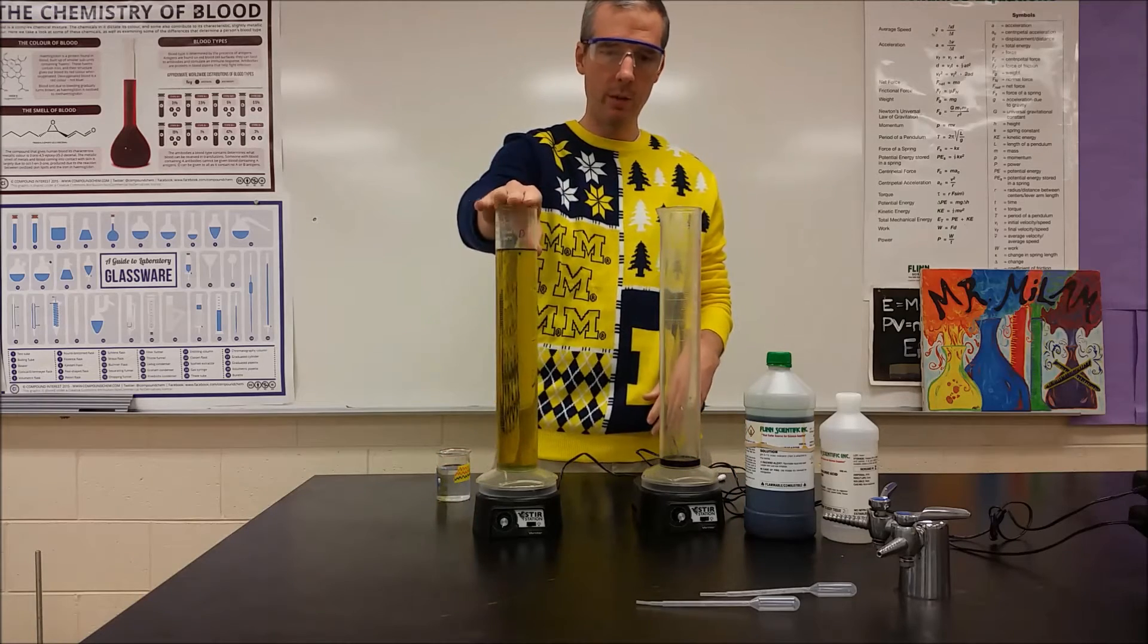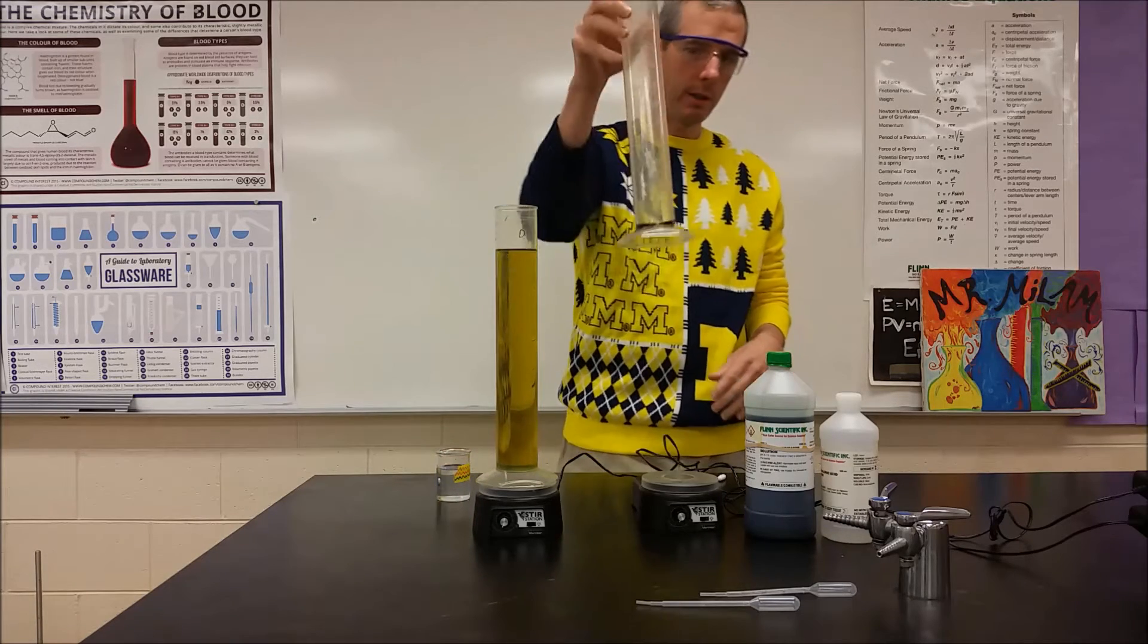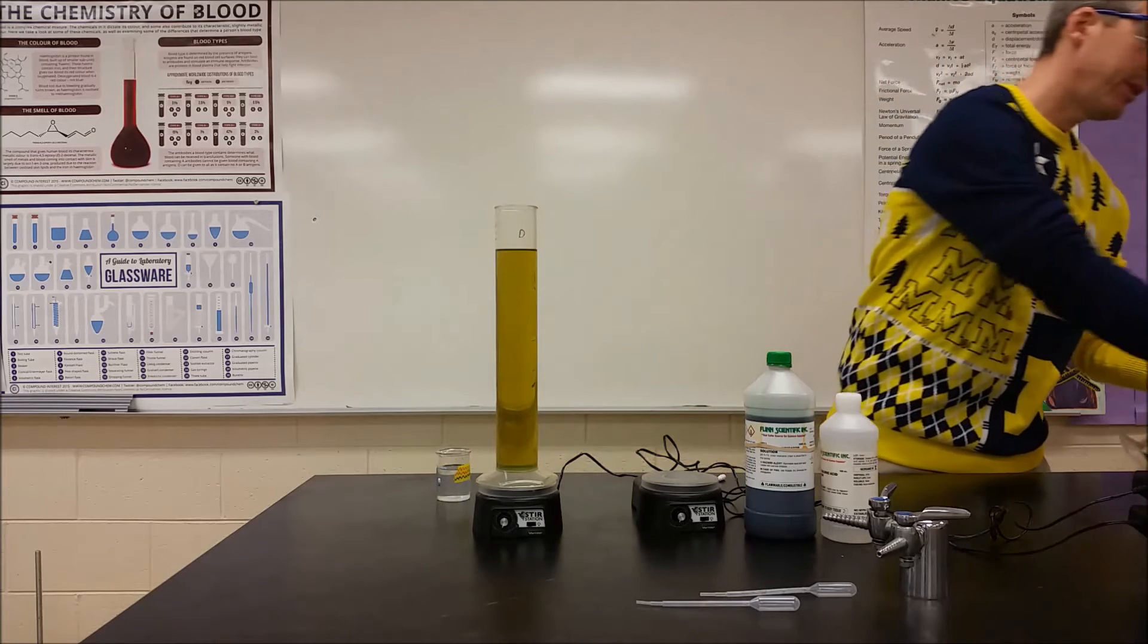I'm going to compare distilled water with tap water. I'm going to take this and fill it up with tap water from the sink.